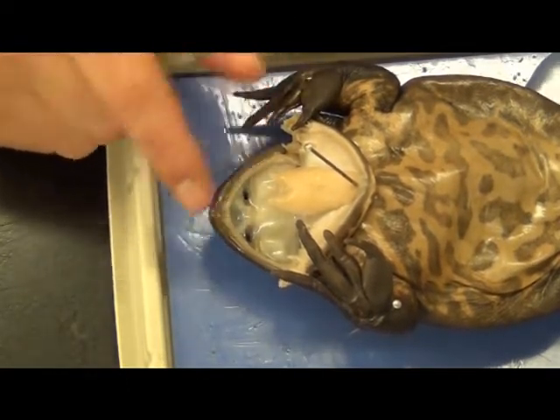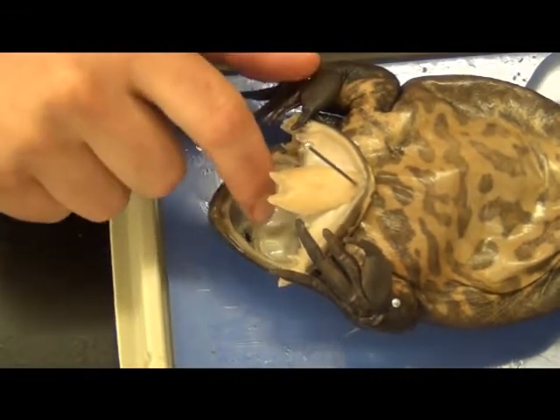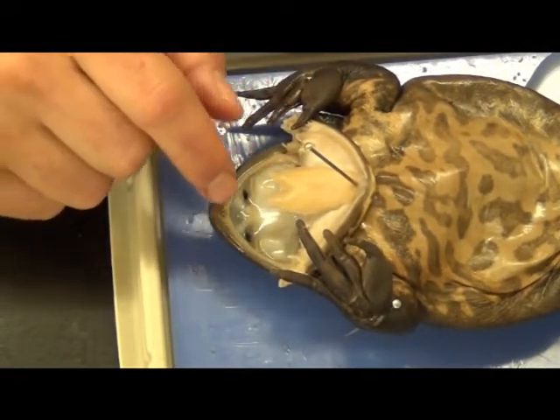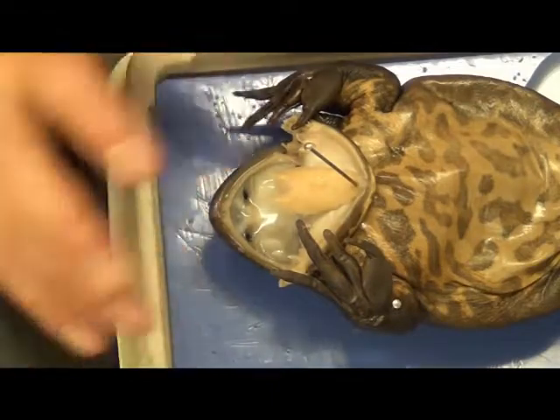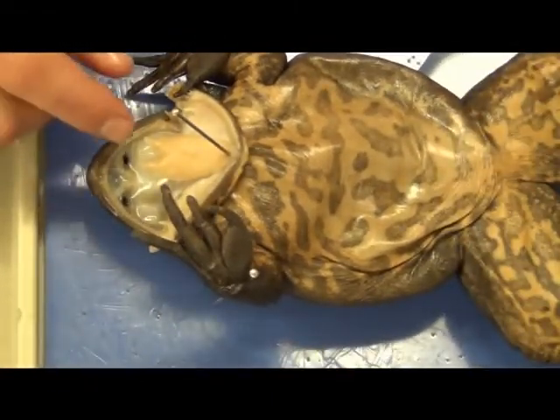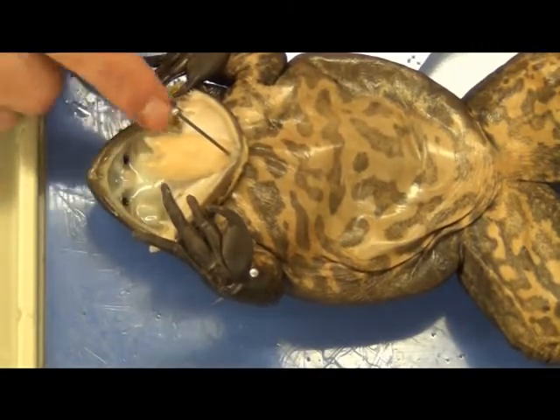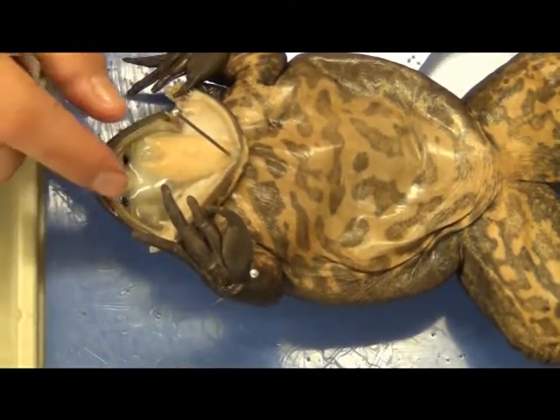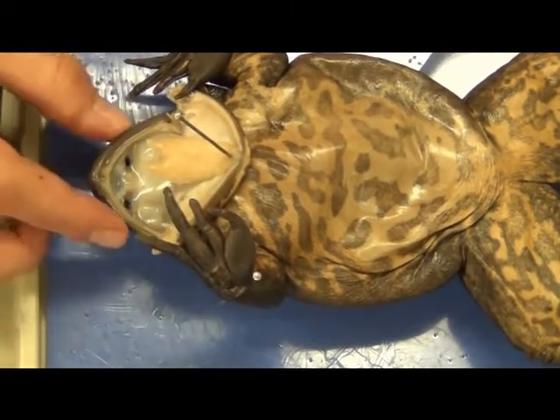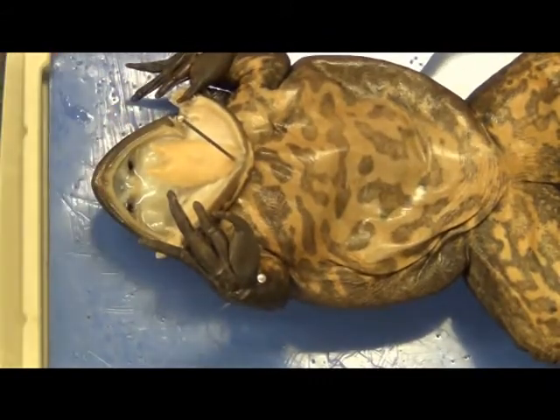So anything — a mouse, another frog, a bird — any prey that he's going to grab onto, this is going to latch on and inhibit it from escaping. Top predators as far as amphibians are involved. You have the esophagus and effectively a glottis. On the sides, you have two extra tubes — these are the eustachian tubes. And that is your basic layout as far as the inside of the frog mouth.